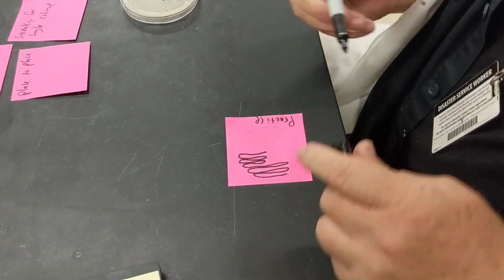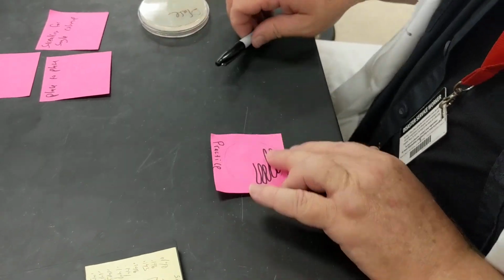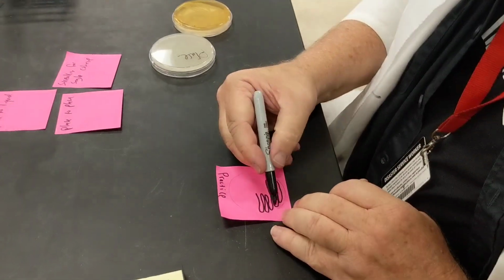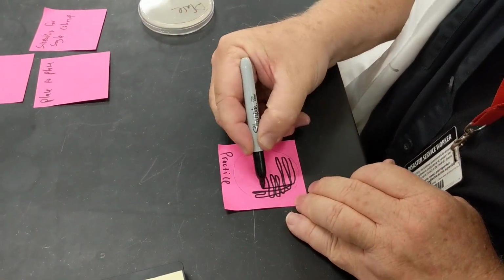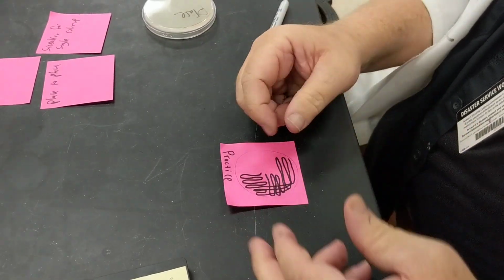Right? And so we did that inoculation there. You flame your loop, and then you go back and forth a couple of times. And if you notice, I'm using all of this plate. Your book describes it slightly differently. These are both techniques for isolating single colonies, and as long as you get single colonies and it works, that's fine. My way will always work, I guarantee that, and I won't mark it wrong if you do that.